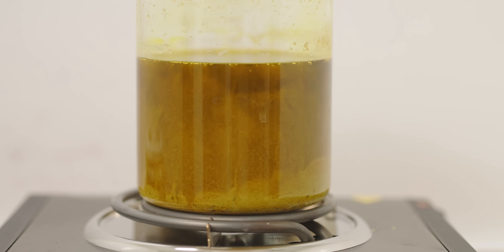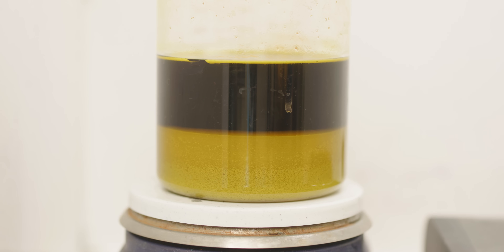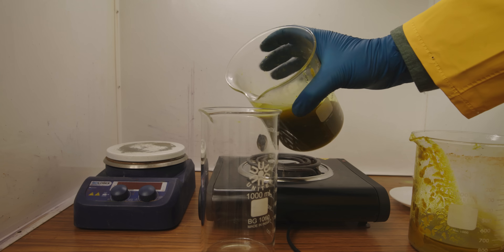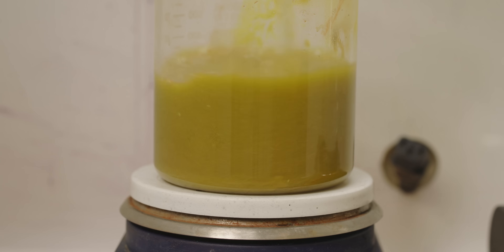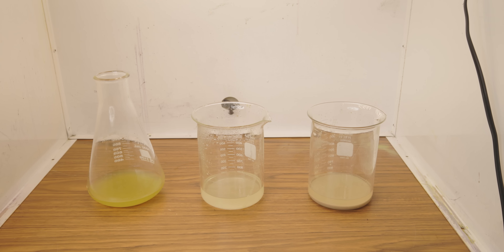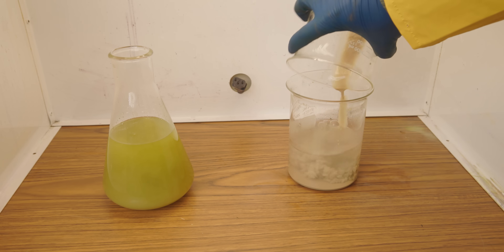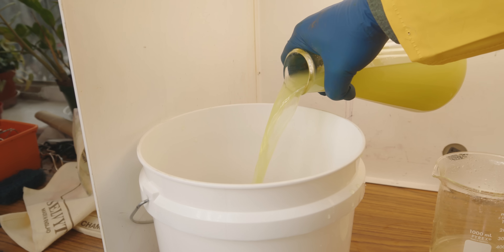I'm going to let things cook a little longer to give the paper more time to dissolve. Once everything settles the second time, I discern that the middle paper level is not as prominent. I'm satisfied enough to move to the next step. I'm next going to slowly pour off or decant the hydrochloric acid. I need to rinse, clean, and isolate the silver chloride — pouring in hot water, swishing it around, and decanting it off. I eventually decide a system with three beakers is best: the first contains the bulk of my silver chloride, the second acts as a buffer capturing any small traces of silver that accidentally pour out, and the third beaker acts as the bulk of my stock water, eventually added to a stock pot once it reaches capacity. The goal is to have zero silver making its way to the bucket. Through a number of hot water baths, we can see just how far we've come in cleaning this silver chloride.